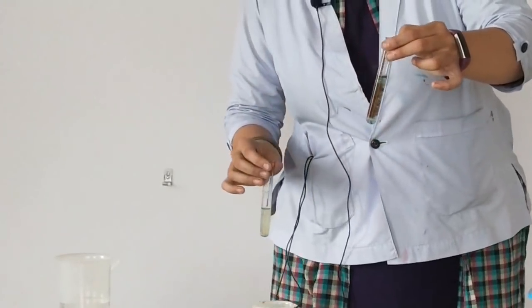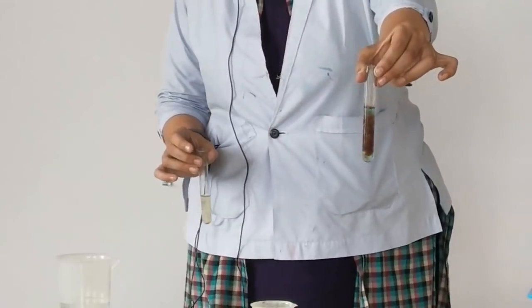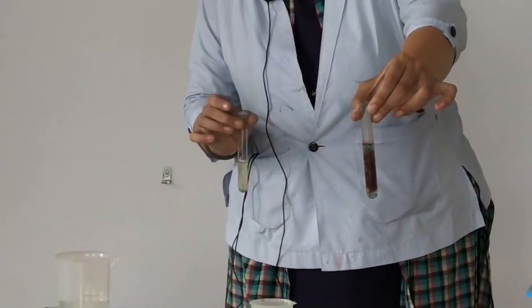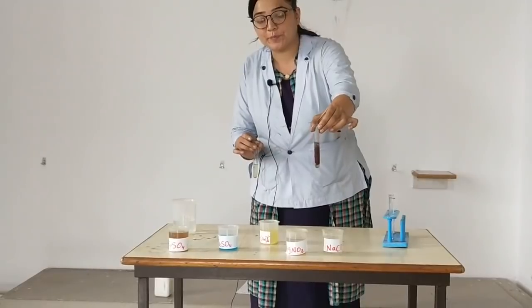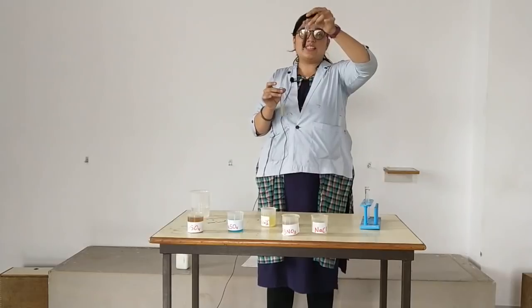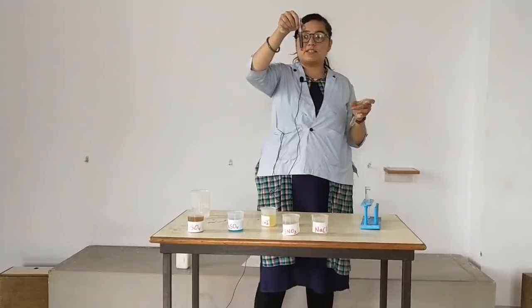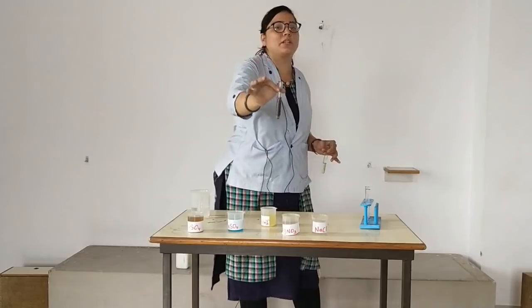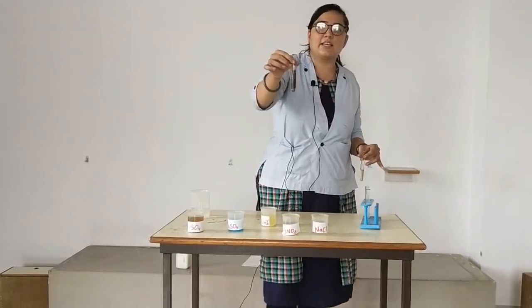Okay, can you see something that got stuck, the brown colored precipitate, which is not at all moving. I'll hold on for you. So you can see it's not shaking either. The structure of it is somewhat, you can see how it has settled properly. Just observe it. You can just zoom in and see.